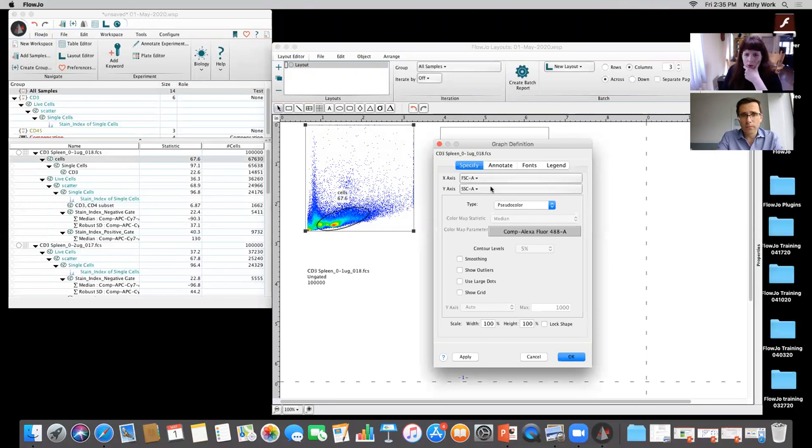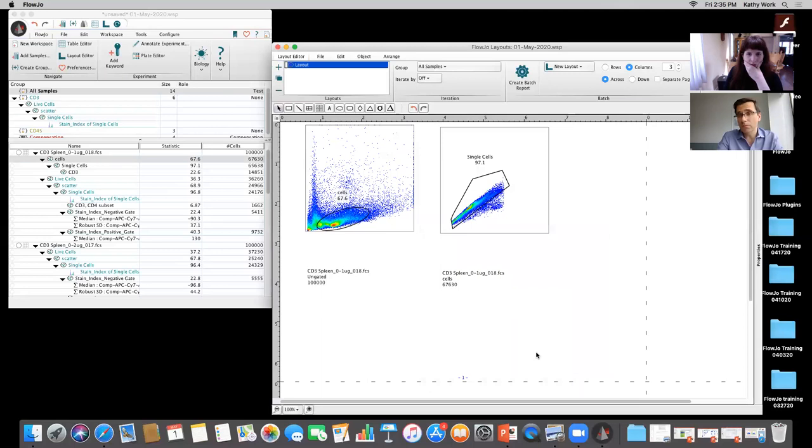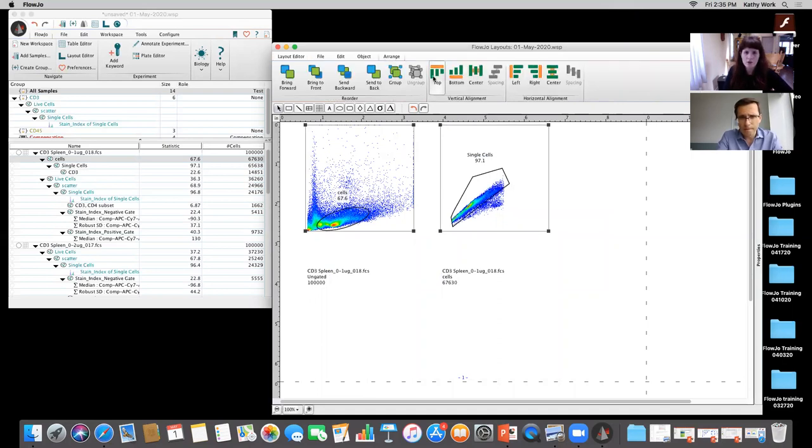So the question is, in the latest version of FlowJo, I'm unable to put the FACS plot layouts in the layout editor into a grid. So I'm guessing to be aligned. Well, to be aligned, you would typically go to Arrange up here and do that and make sure that that's aligned there. I'm not sure that's something I've necessarily done before.